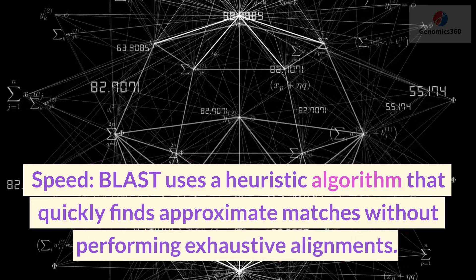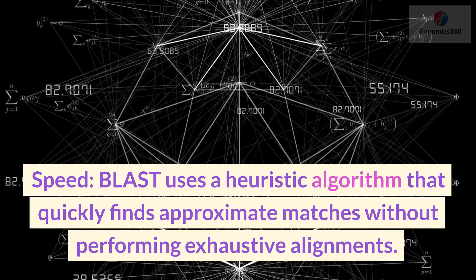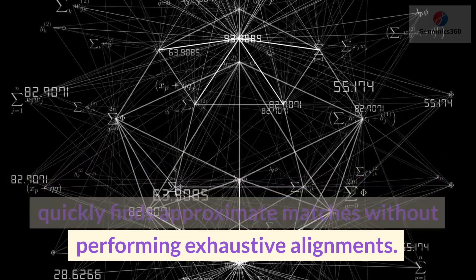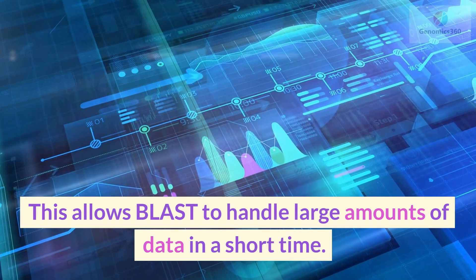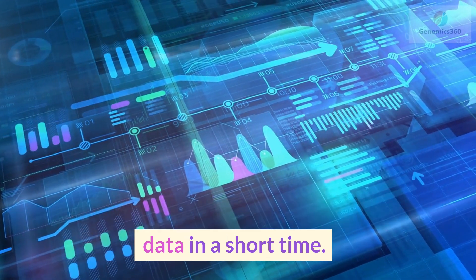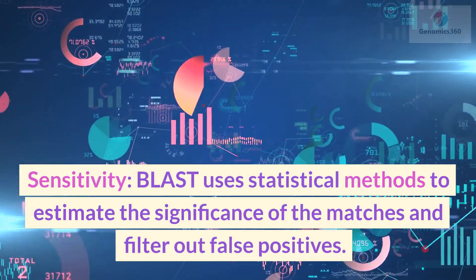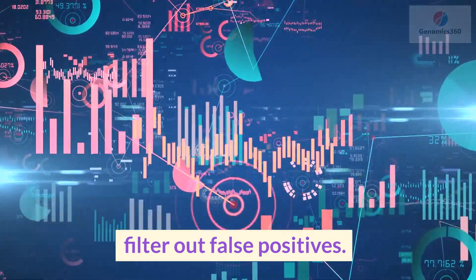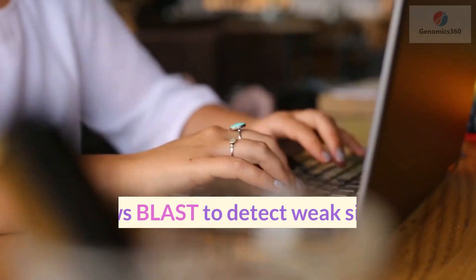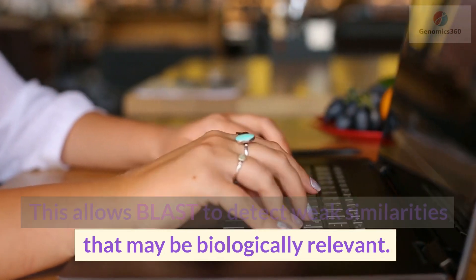BLAST has several advantages over other sequence alignment methods, such as speed: BLAST uses a heuristic algorithm that quickly finds approximate matches without performing exhaustive alignments. This allows BLAST to handle large amounts of data in a short time. Sensitivity: BLAST uses statistical methods to estimate the significance of the matches and filter out false positives, allowing BLAST to detect weak similarities that may be biologically relevant.